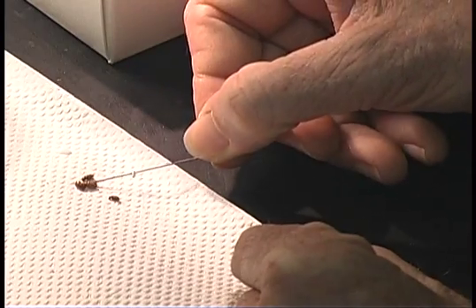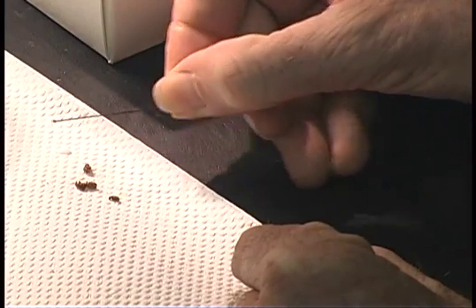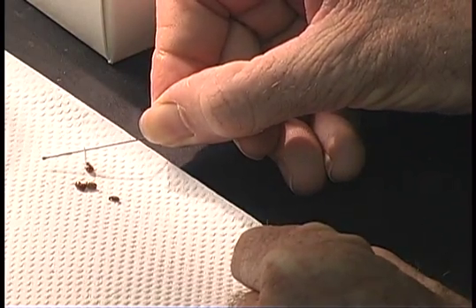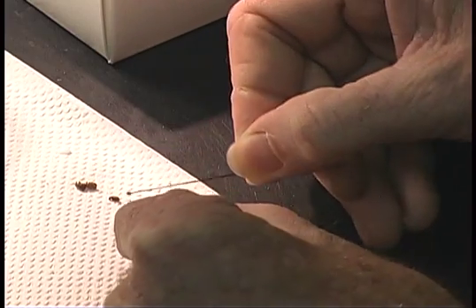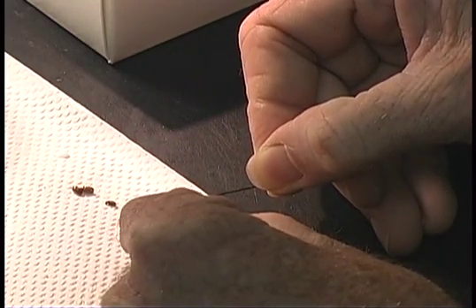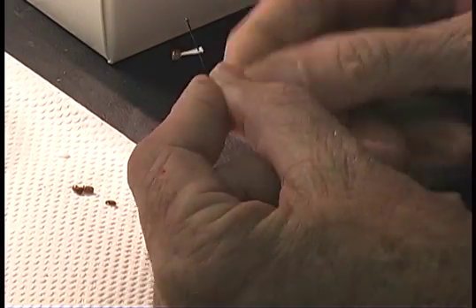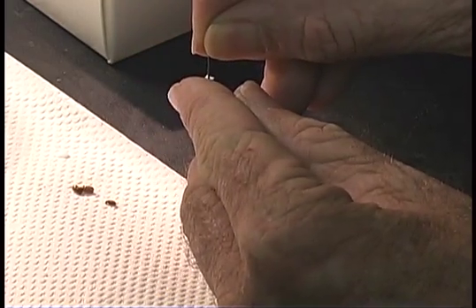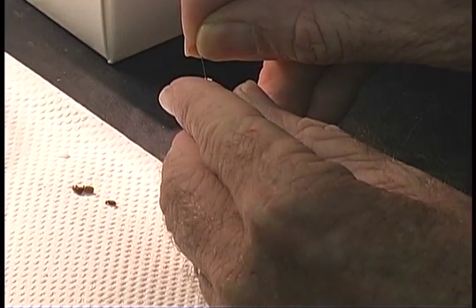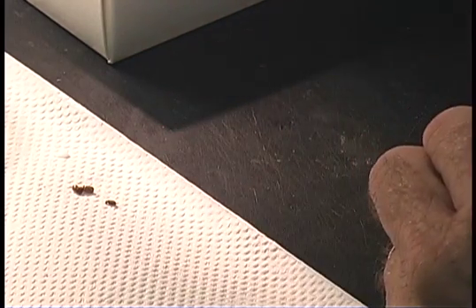Pick up a little bit of glue. Pick out your target. Roll it upside down. Get it into the appropriate position. You want to apply the glue, the tip of the point, to the right side of the insect, about in the middle of the thorax region. Give it a little bump. Make sure it is glued on there straight.